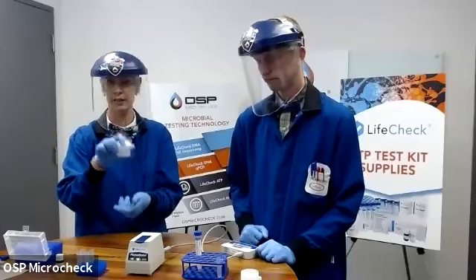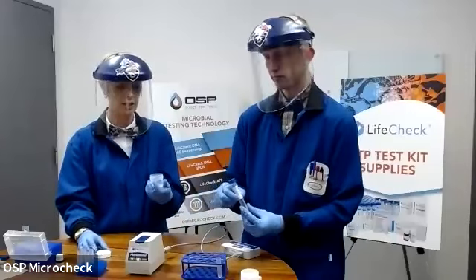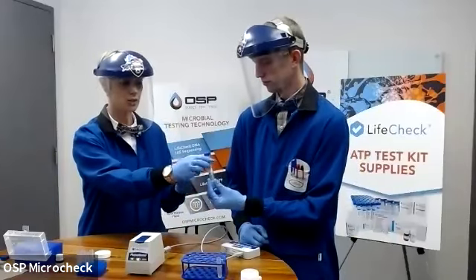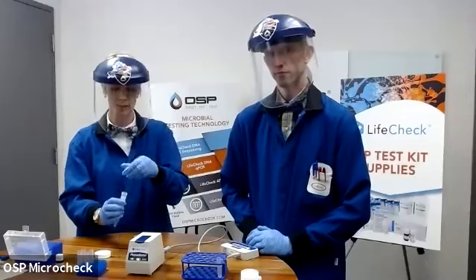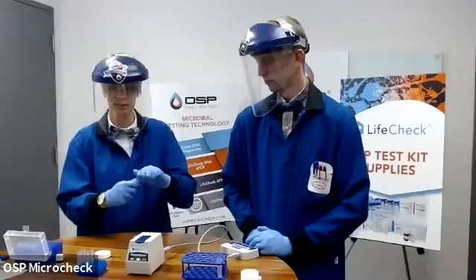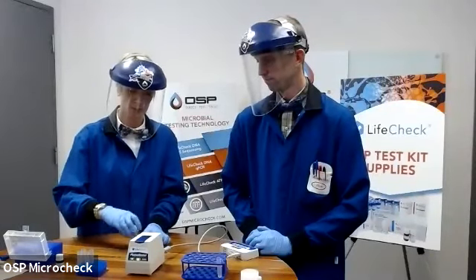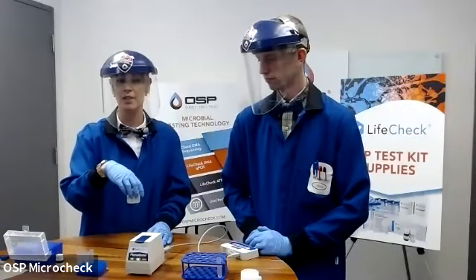Excellent. So, like I said, this could be sitting for a little while, waiting for you to get back to a certain spot. And if you haven't pushed directly into the tube, at this point, we're just going to take this tube of our reagent D. We're going to pour it into the field container where our sample's collected. Place that lid back on and give it a little swirl, make sure it's good and mixed.